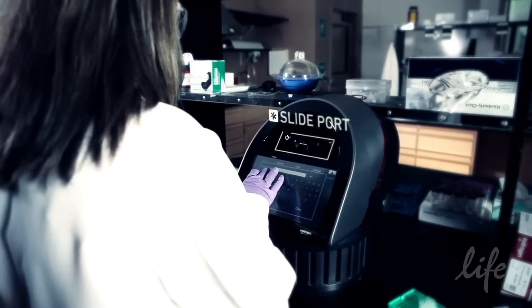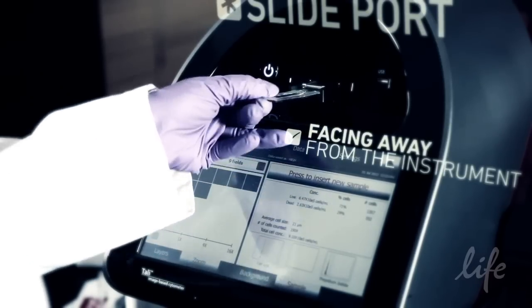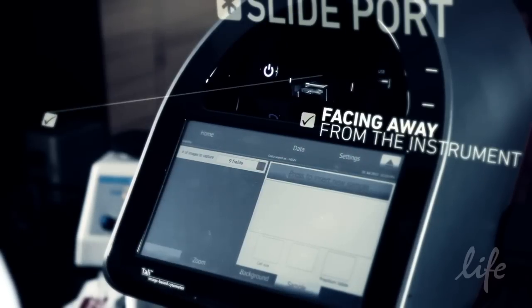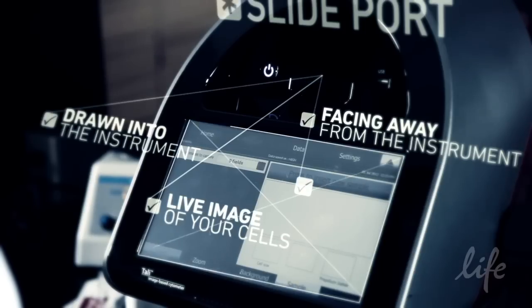Load the slide into the slide port with the chamber containing your sample facing away from the instrument. Touch the press to insert sample button. The slide will be drawn into the instrument and a live image of your cells will be displayed on the screen.